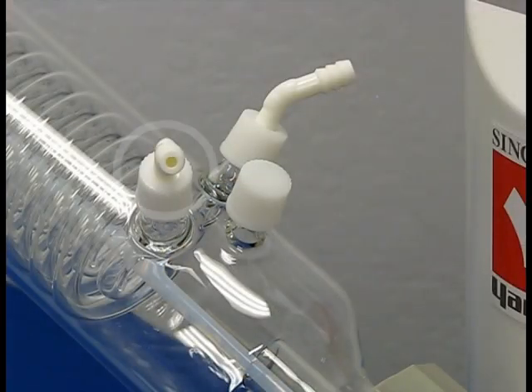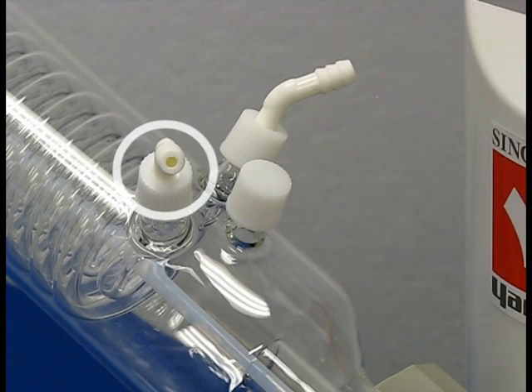When using a water circulation unit, connect the left nozzle on the condenser to the inlet valve of the water circulator and the right nozzle to its outlet valve.